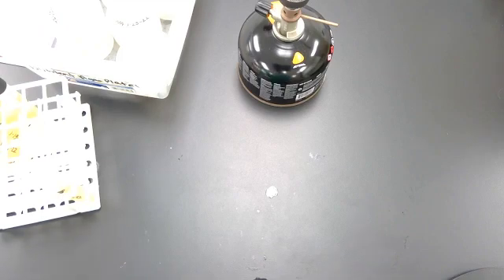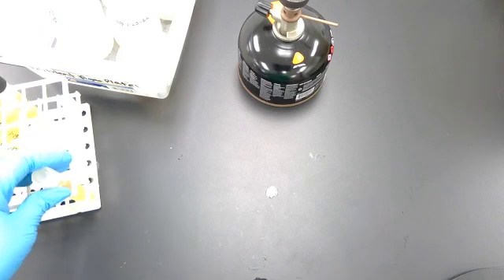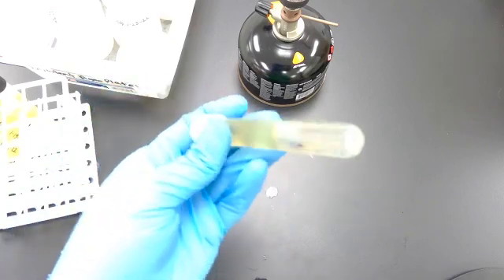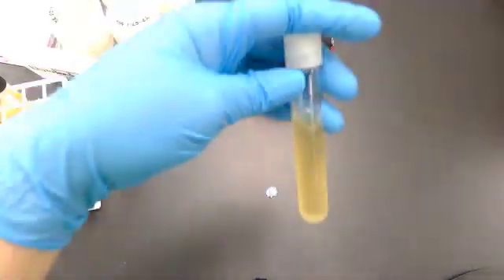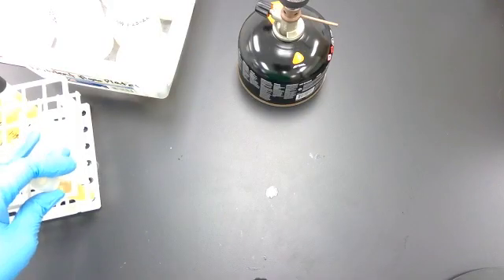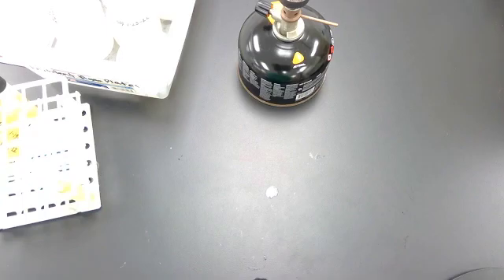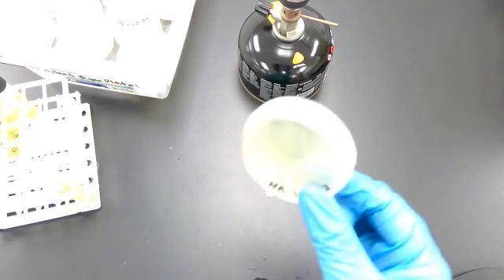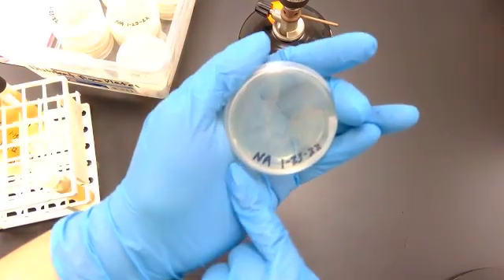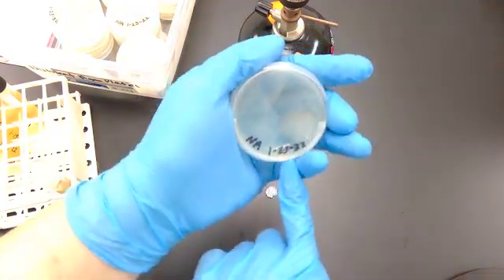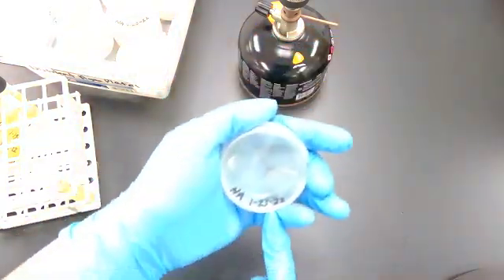Let's talk pure culture. You are going to obtain a mixed culture of liquid bacteria, then you are going to obtain a plate of nutrient agar. Now this is nutrient agar I made on January 23rd.